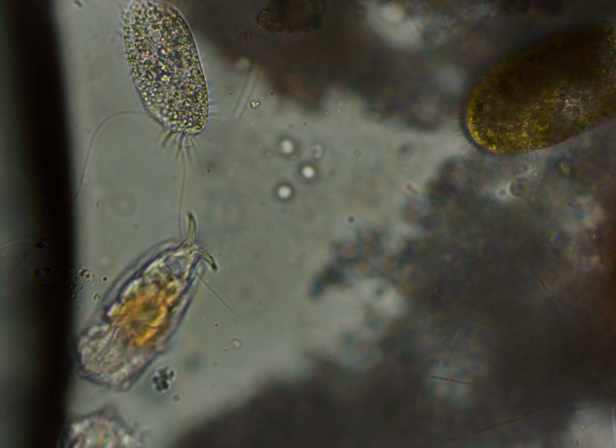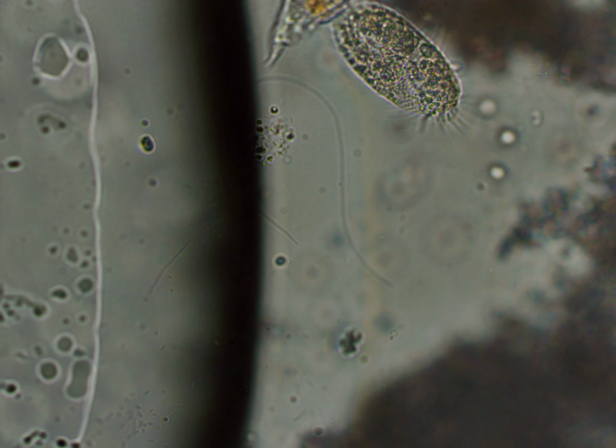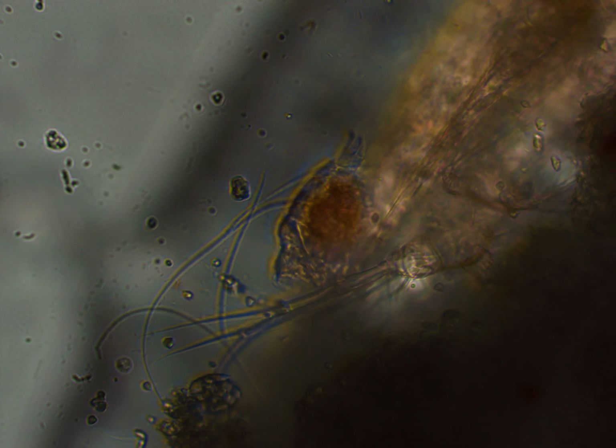Here is a bunch of rotifers and that small hypotrich. Those all seem to be from the class Monogononta, and there's a small organism there, which is not a tardigrade as it looks, but that is actually a rotifer, which I was not expecting. Anyways, this isn't really the habitat where you would find tardigrades, but that's just a very interesting rotifer.